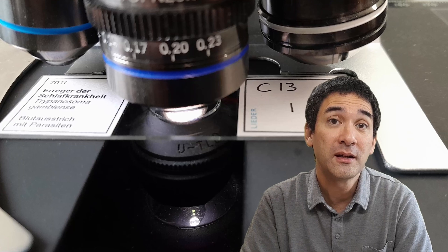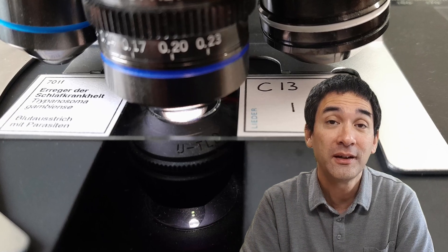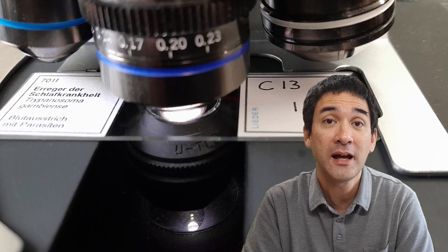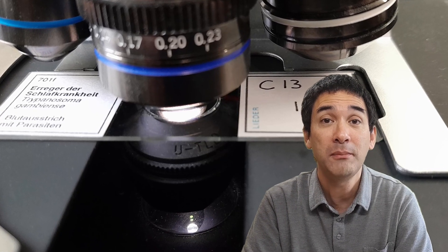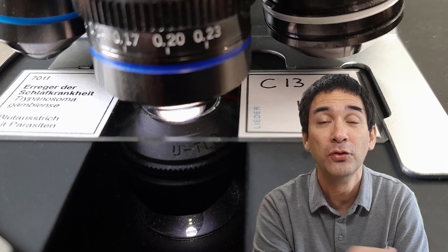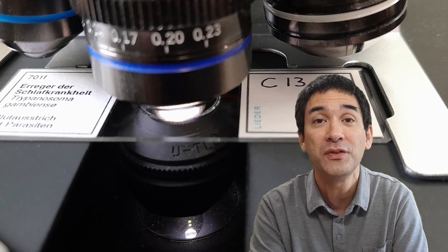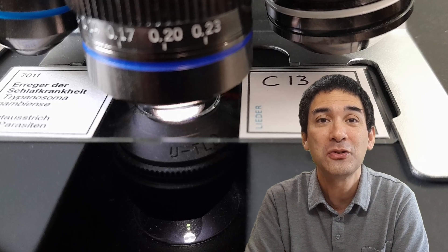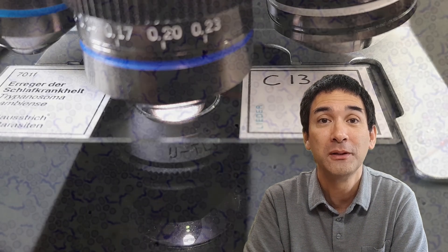I put this permanent slide under the microscope and looked at them. Unfortunately I was not able to see them move because, for safety reasons, I do not want to use fresh blood — I used a prepared slide here.